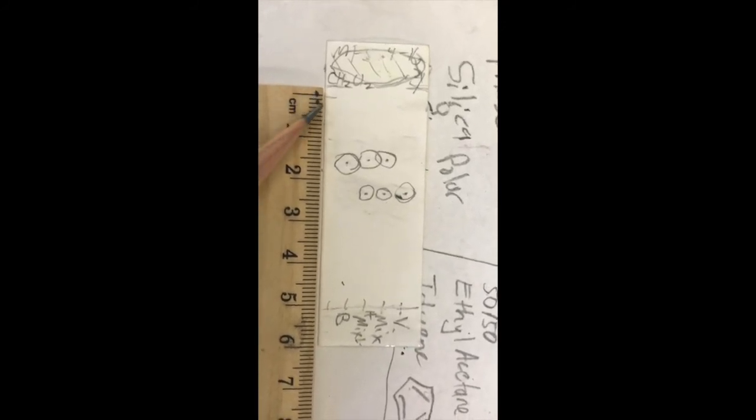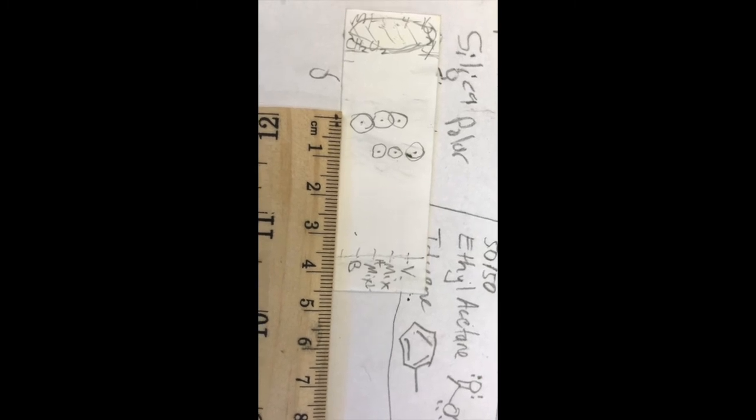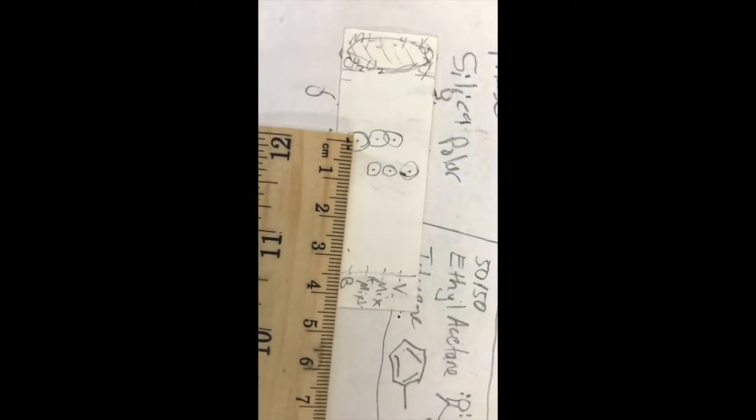So I put the ruler at 0 for the solvent front, and it looks to me about 5.2 centimeters. Let's look at it closer. What do you think, 5.2? Yeah, we'll go 5.2. And now let's measure the benzophenone, that one's a higher spot. Let's put this at about the center of that one. So benzophenone looks like it's coming out at about 4.1 centimeters. That's good. And the vanillin looks like 2.85 maybe. I like it. So there we go. We can calculate RFs with this.